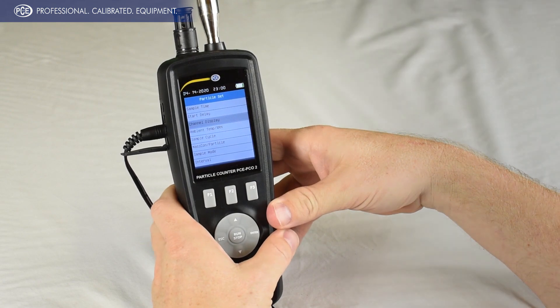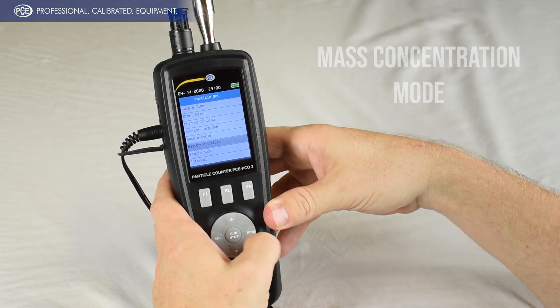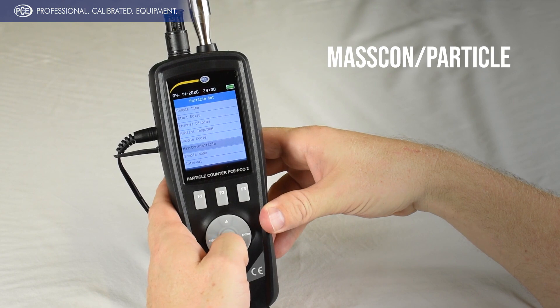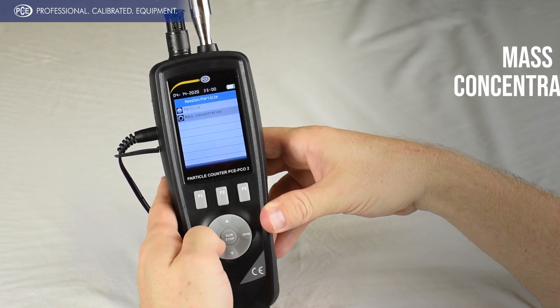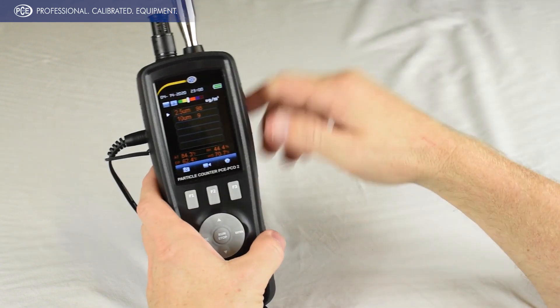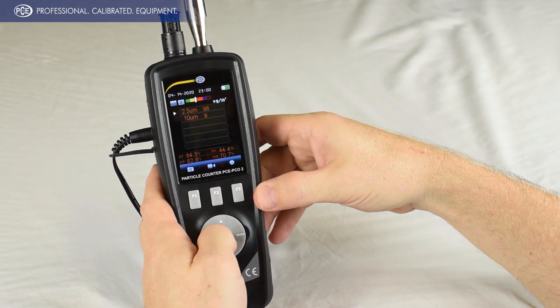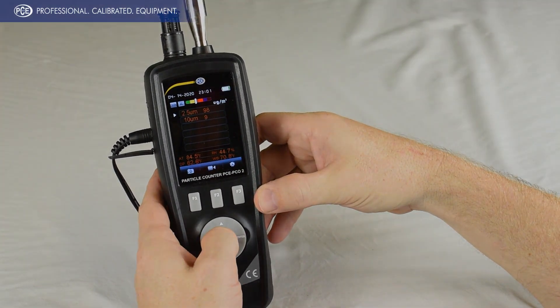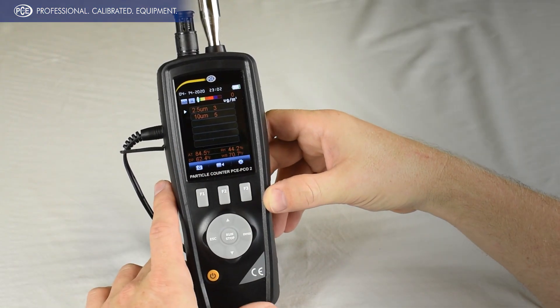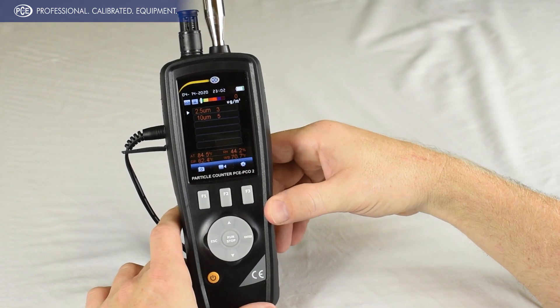For the next sample, we're going to do the mass concentration mode so you can see the PM 2.5 counts. Go to where it says mass con particle, hit enter, and then select mass concentration, then escape. You can see it's now saying micrograms per meter cubed. We'll start another sample. As you can see, the numbers for your PM 2.5 and 10 can be used for assessing air quality and the AQI index.